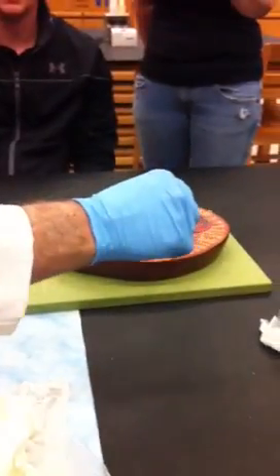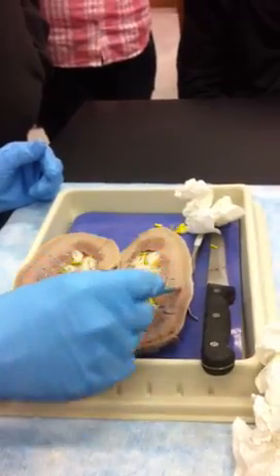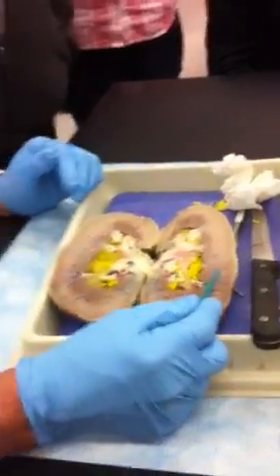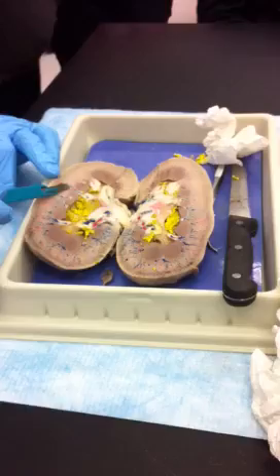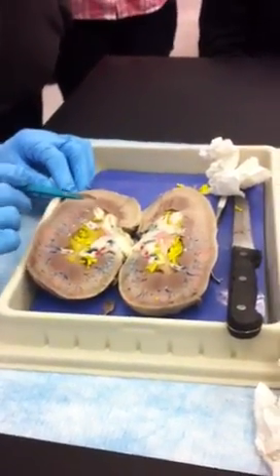The capsule will be right on the surface there, but there's the cortex. You can see some of the cortical radiates coming out, right? And the veins coming back. These aren't the best I've ever seen, but these are pyramids.